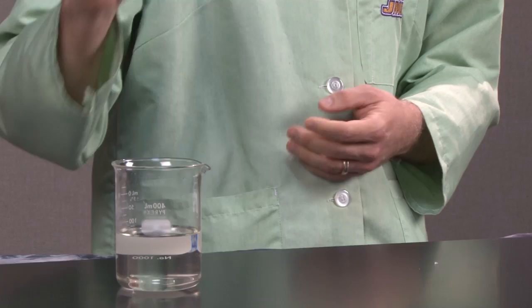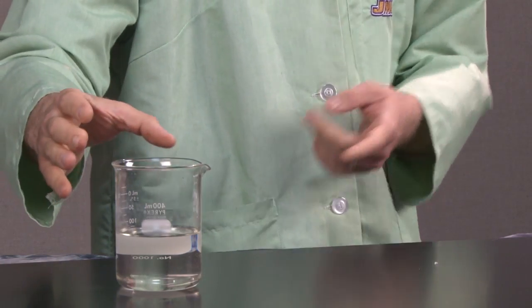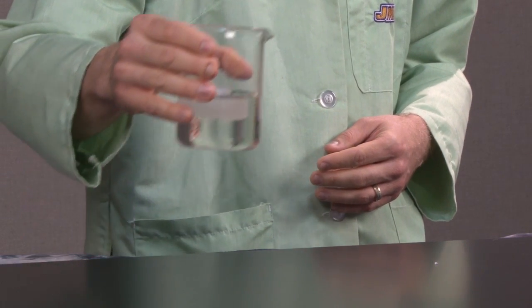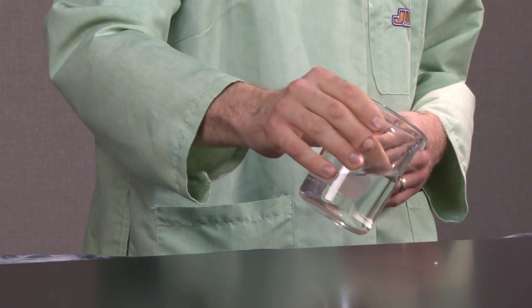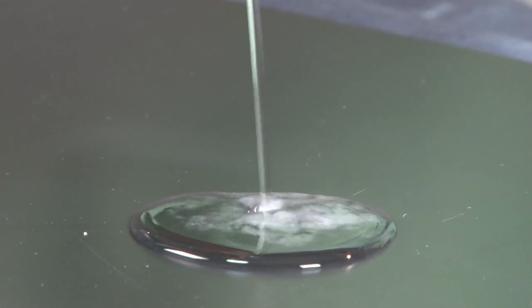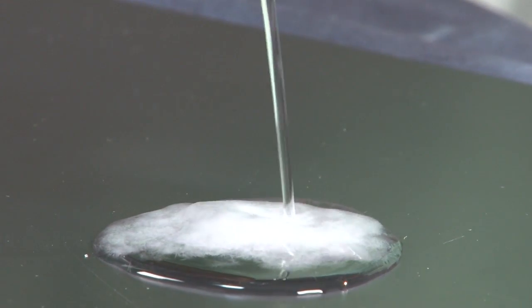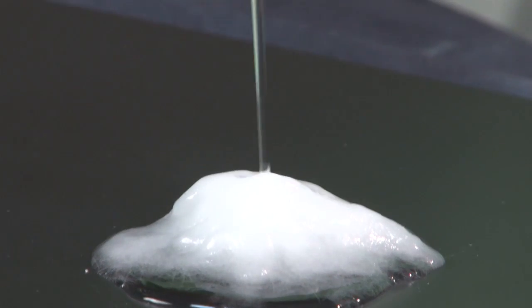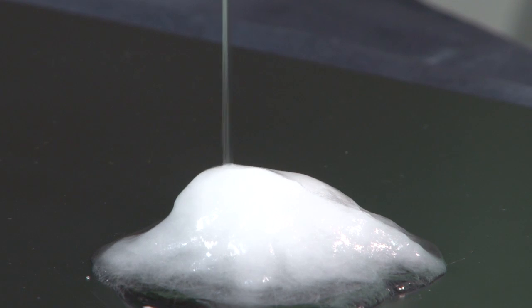What I'm going to do today is I'm going to very carefully pour this solution on top of the seed crystal that I have here on the bench. And we'll see what happens. So as you see, the crystallization is happening around that seed crystal.